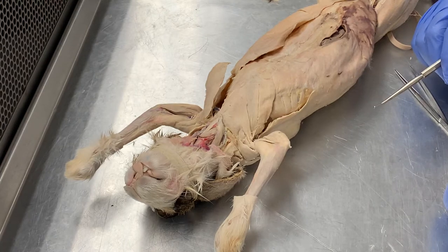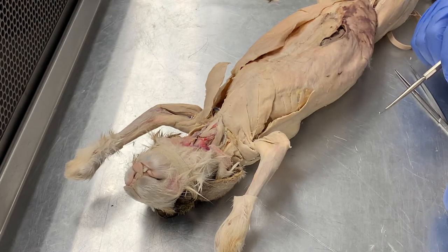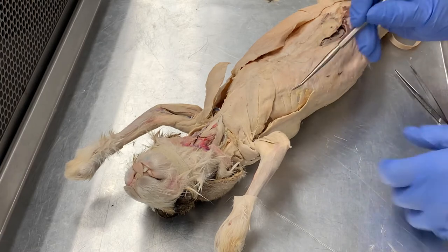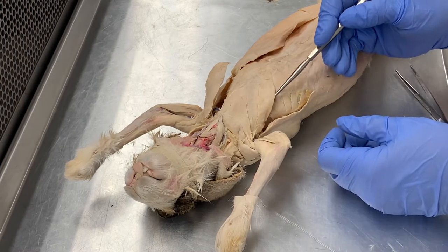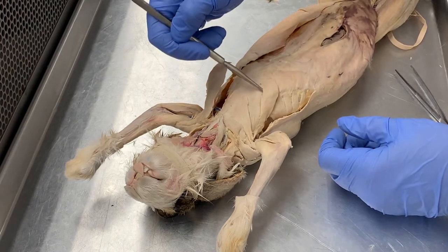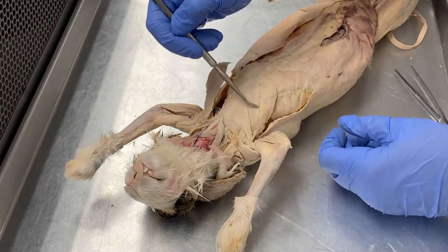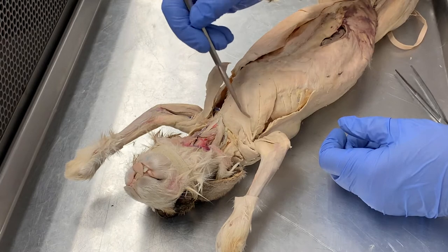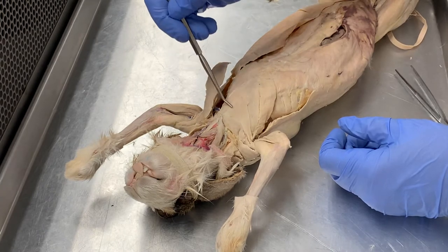For the superficial chest muscles on the rabbit we see the pectoral group. The most caudal is the pectoralis minor, that is this one here, and then we have the large pectoralis major which has separated into two sections but it is all one muscle.